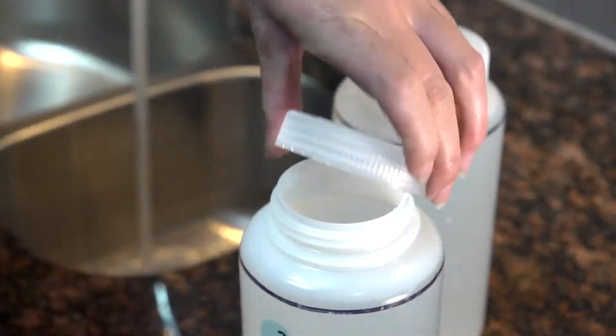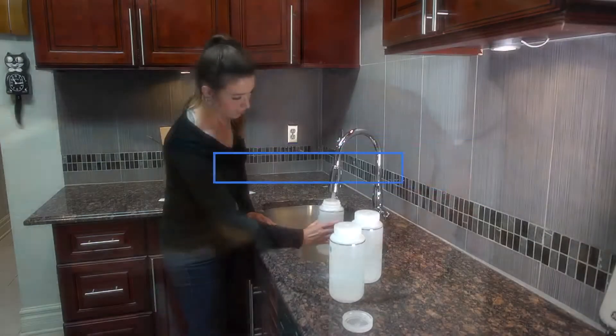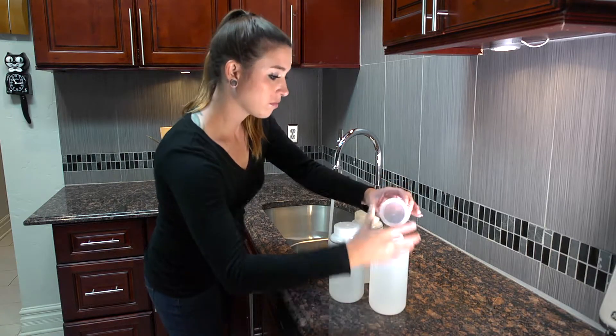Once that bottle is filled, let the water run 25 seconds again before you fill the final bottle. It's important to let the water run until all three samples are collected.